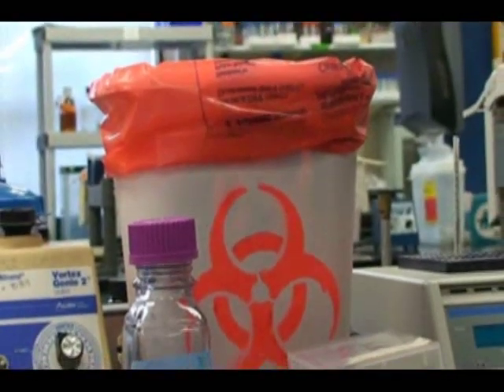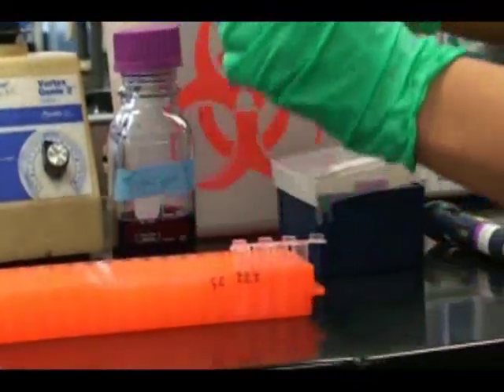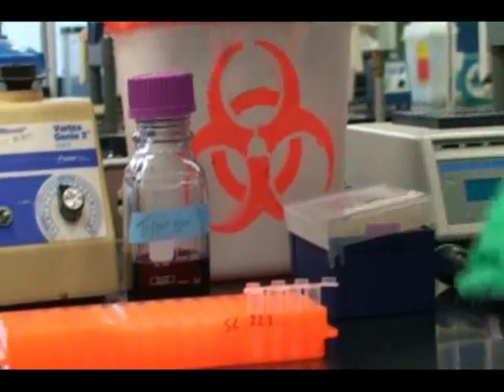Next, throw out the pipette tip, close the tube and gently vortex. This is your 1 tenth or 10 to the negative 1st dilution.